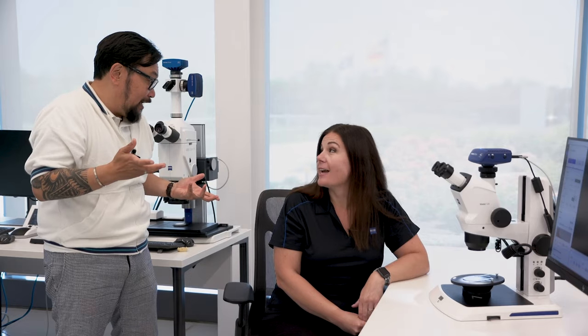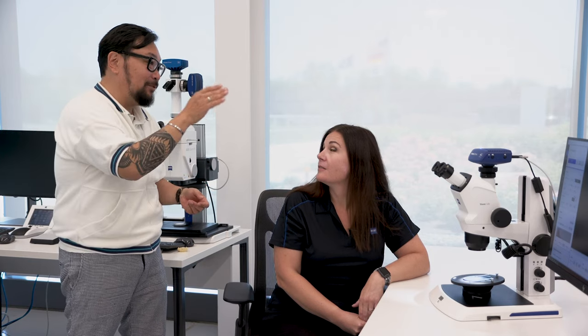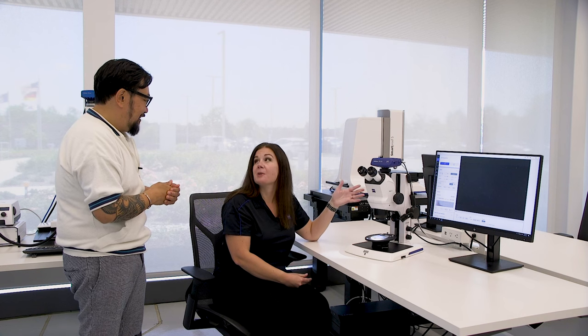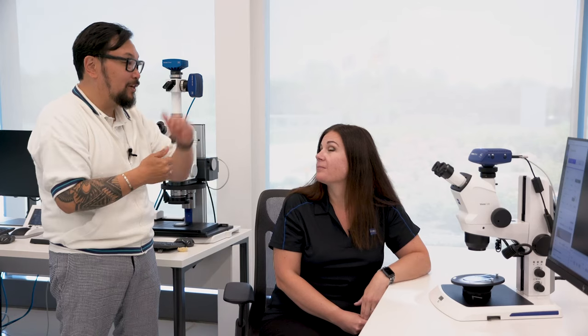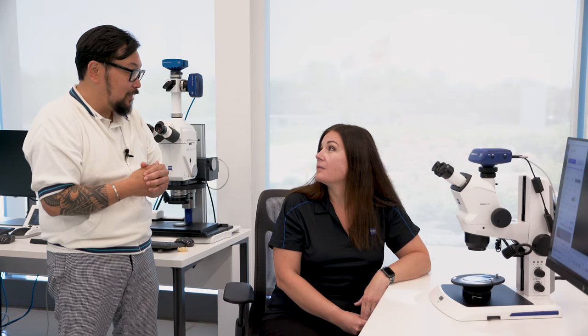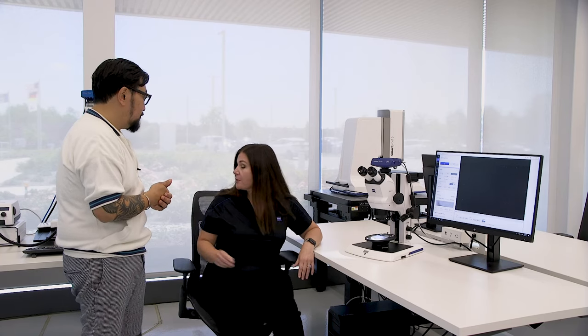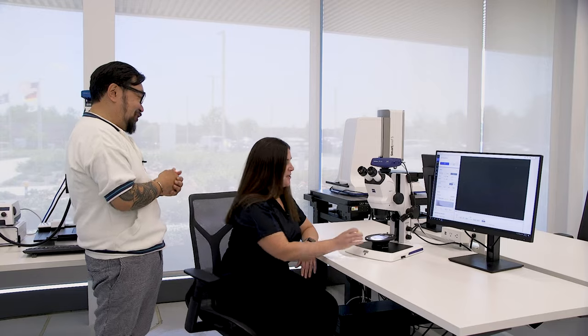We've also added cameras so we don't have to be an artist anymore. You can really see the evolution of automating that. I certainly would not be able to do it old school because I'm a horrible artist. So you take that out of the equation — you can quickly capture images, take measurements, mark off the image, do all sorts of things, all because we put a camera there. Can we see this run? Sure. I heard that you and Robert were having some fun with chips — he enjoyed the hot sauce, so I thought we could maybe take a look at a chip.